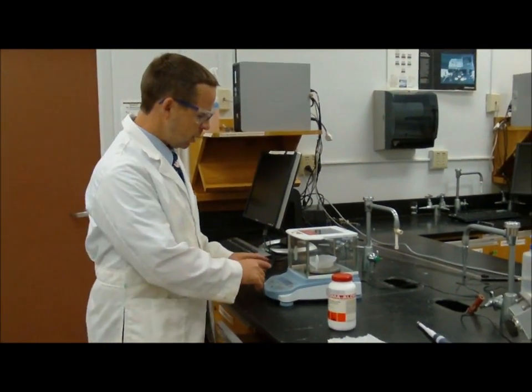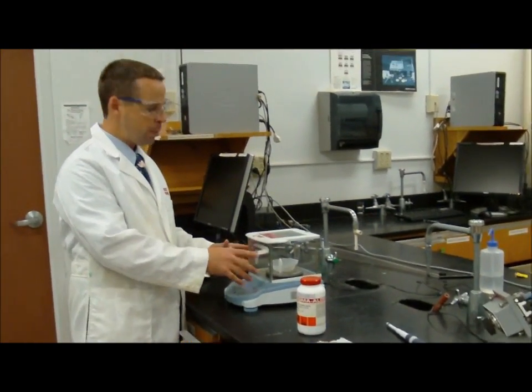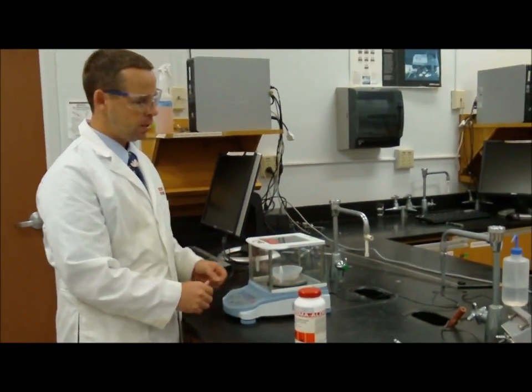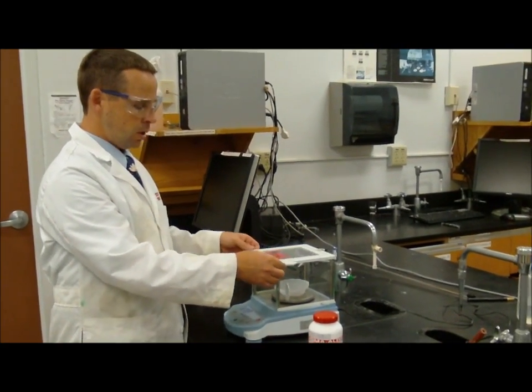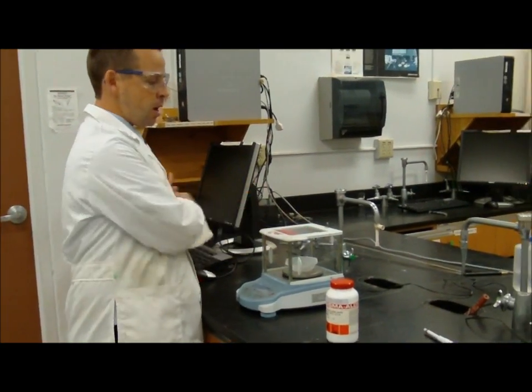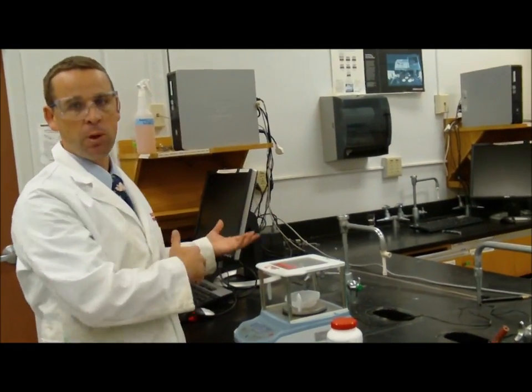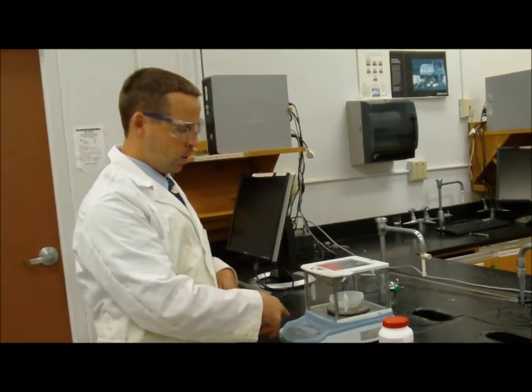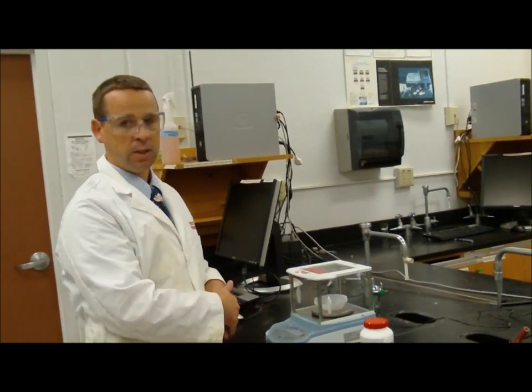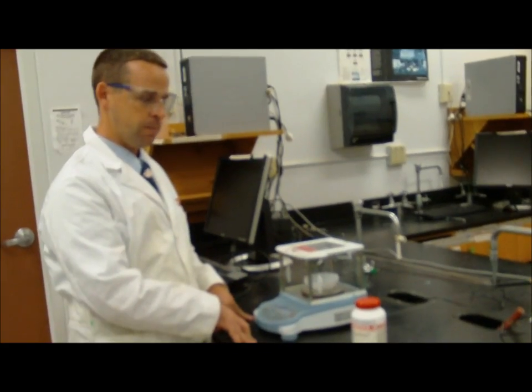All right. Again, I have my weigh boat in there. The weigh boat's not touching the walls or anything. The walls, the doors all need to be closed, because if they're not, then just the air of me moving around the lab, or the air from the air conditioning, or doors opening and closing, is enough to change the mass and alter the sensitivity of the instrument here.